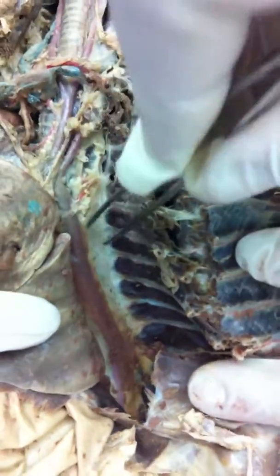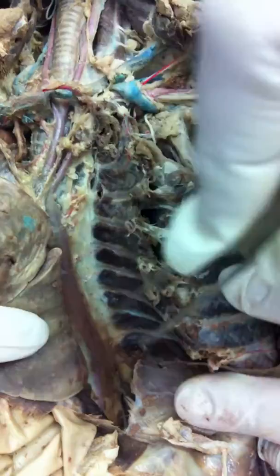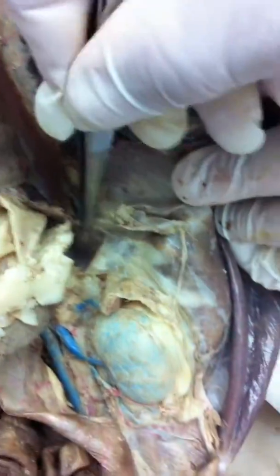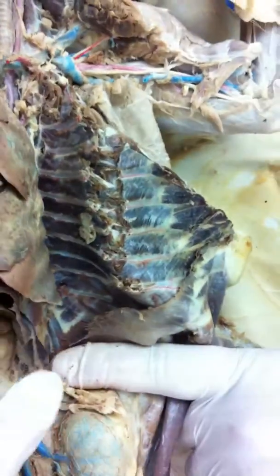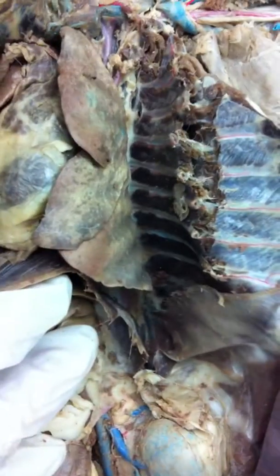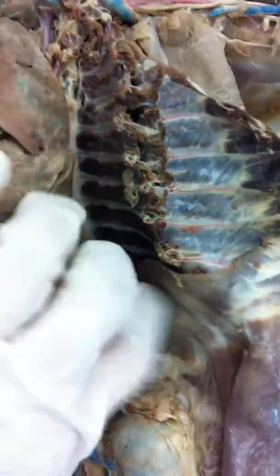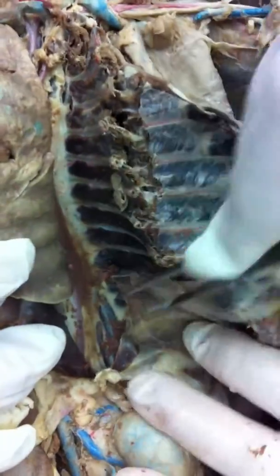So we want to follow what's going on. Now, you know there's some small branches, some intercostals that go out to the ribs. And you know what this structure is. What is this thing? That's the diaphragm. Now, the trick is going to be picking this guy up after it goes through the diaphragm and not losing it. So up top, it's the thoracic. In the chest, we call it thoracic. Once it goes through the diaphragm, we call it abdominal. Those are just labels. Don't let that worry you. Point is, it's the aorta, isn't it?